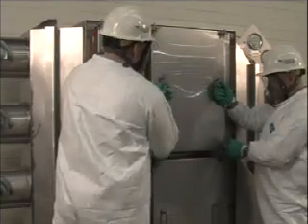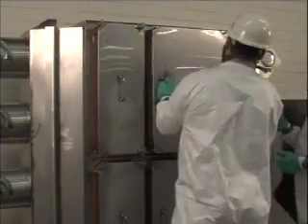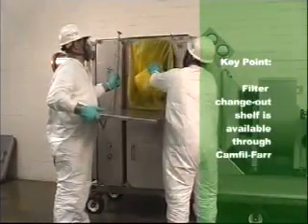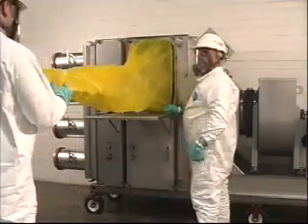Gain access to the inside of the filtration housing by removing the housing access door. Pull the access door straight towards you to remove. Place the access door in a safe location, out of the way until the filter changeout is complete. Next, extend the change-out bag fully. For gasket seal locking mechanisms, turn the drive bolt fully open to release the filter from the sealing surface. For fluid seal locking mechanisms, release the handle latch and slowly open the locking mechanism by pulling the handle fully open, thus pulling the filter away from the knife edge sealing surface.